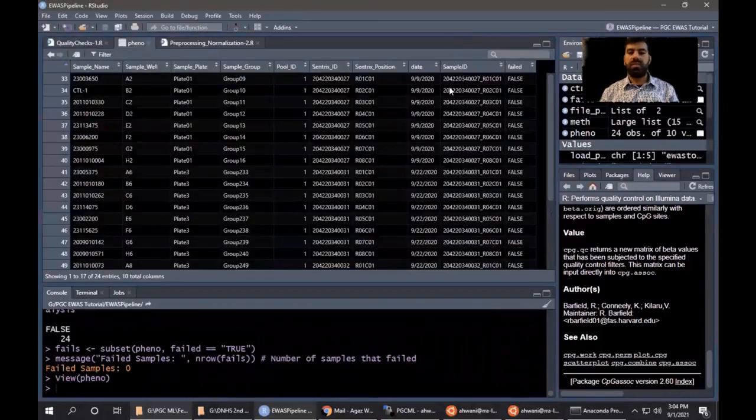So it looks something like this, where we have the sample ID, that is the combination of Sentrix ID and Sentrix position. It will be unique for each sample. And we will have the information here whether the sample failed or passed this step of quality control. So if the sample failed, the value will be true here.